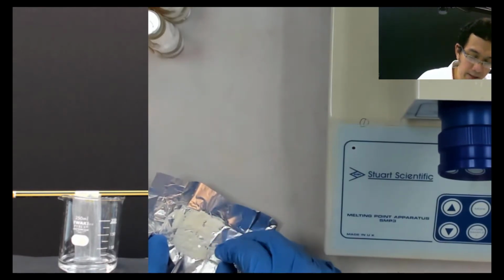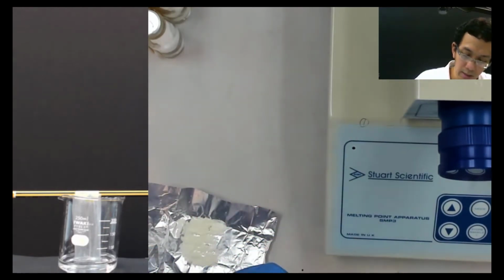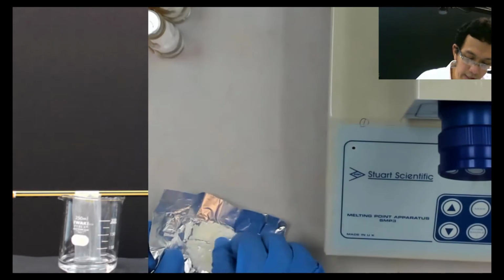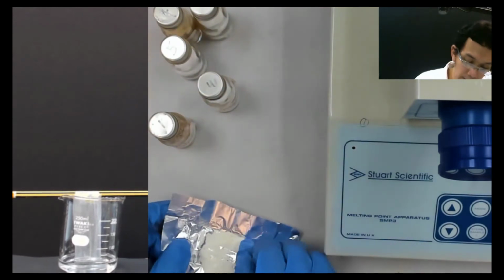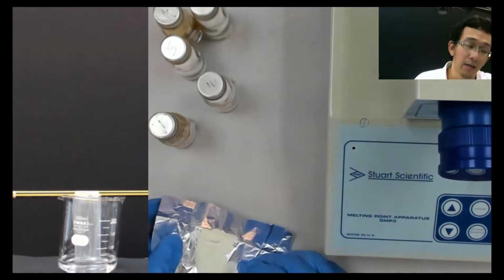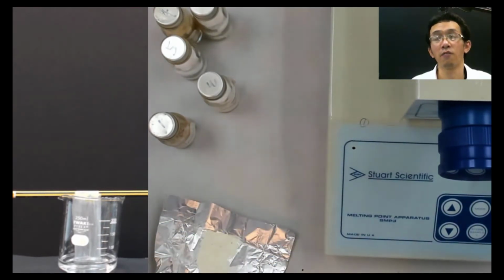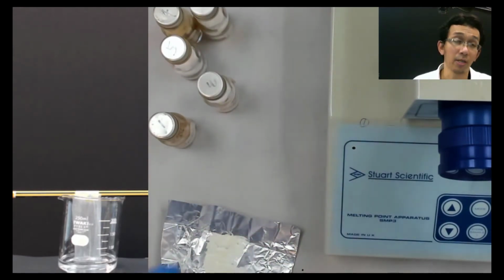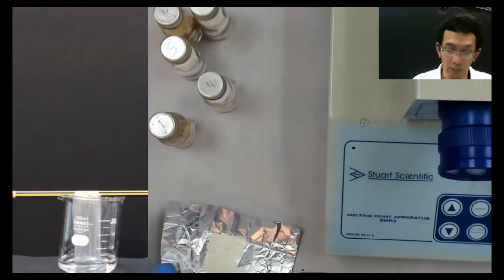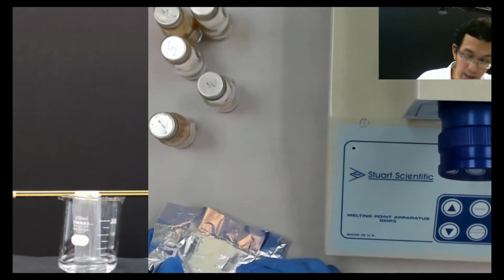TLC itself is easy. I mean, not easy, I mean fast. It's not really long to do TLC. Before TLC, we need to do this melting point identification because you want to know this X and Y are from what group. To do the melting point here is to know what group that belongs to, so that you can narrow down the TLC. If not, you need to do all 12 compounds. As I said, there are 12 known and the 2 unknown come from these 12. So if you don't do this melting point determination, then you need to do TLC for all 12, which is quite a lot. So that's the reason for the melting point.